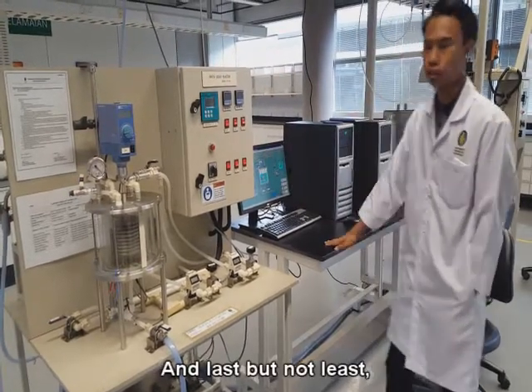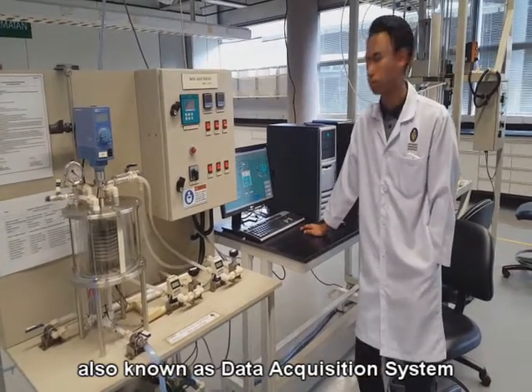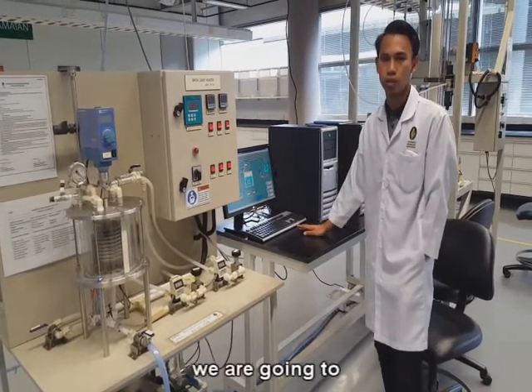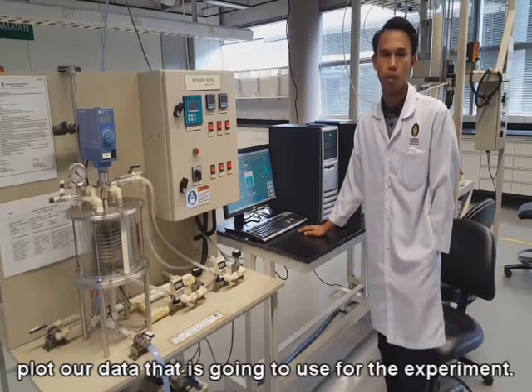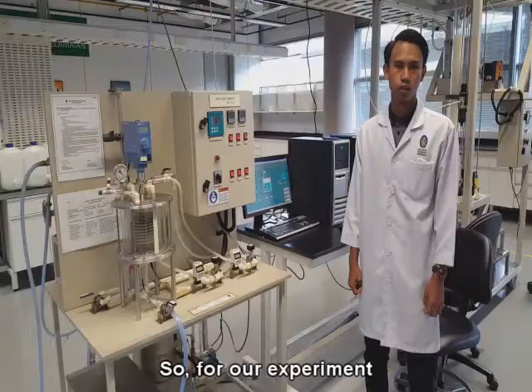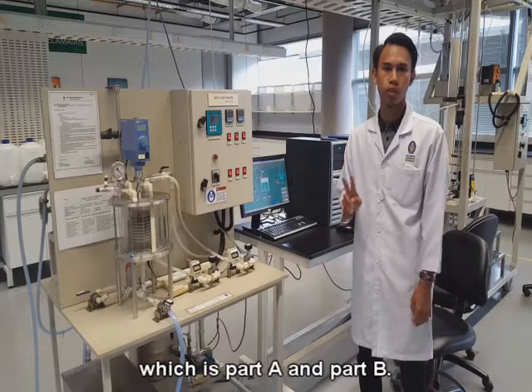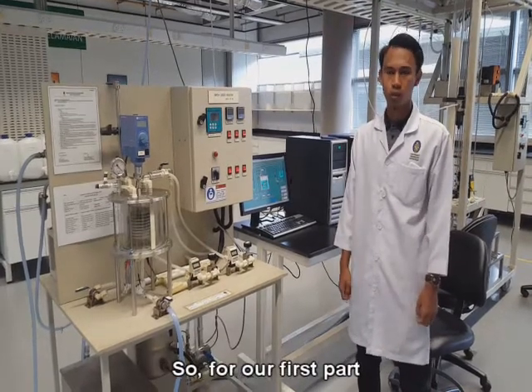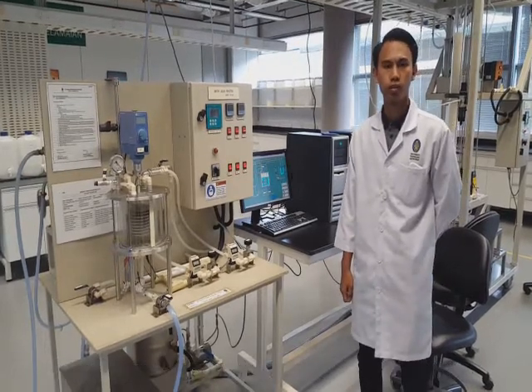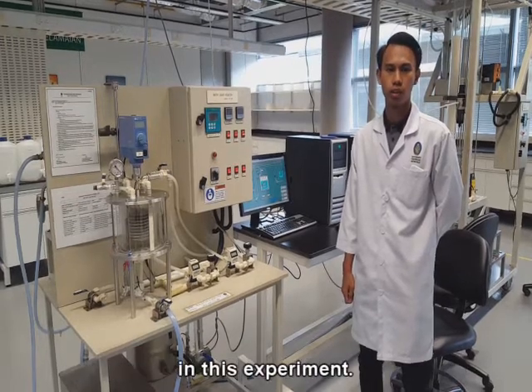And last but not least is the DAS, also known as the Data Acquisition System. In this DAS, we are going to record the data that we will use for the experiment. For our experiment, there are 2 parts, part A and part B. The first part is the preparation of the calibration curve, and the second part is to study the batch saponification reaction in this experiment.